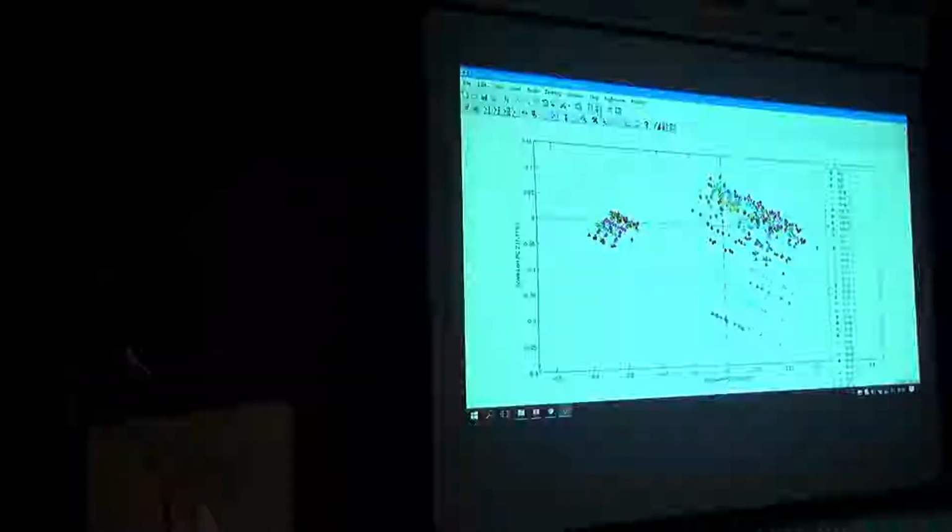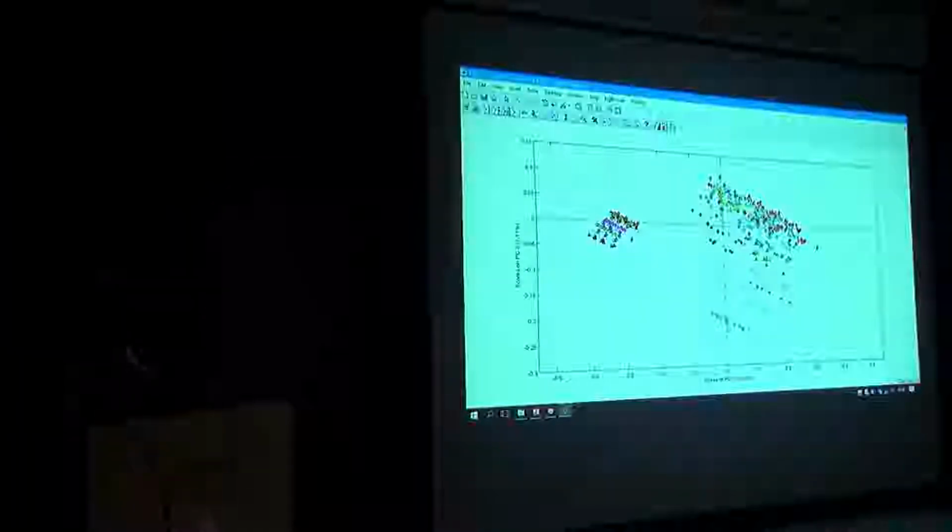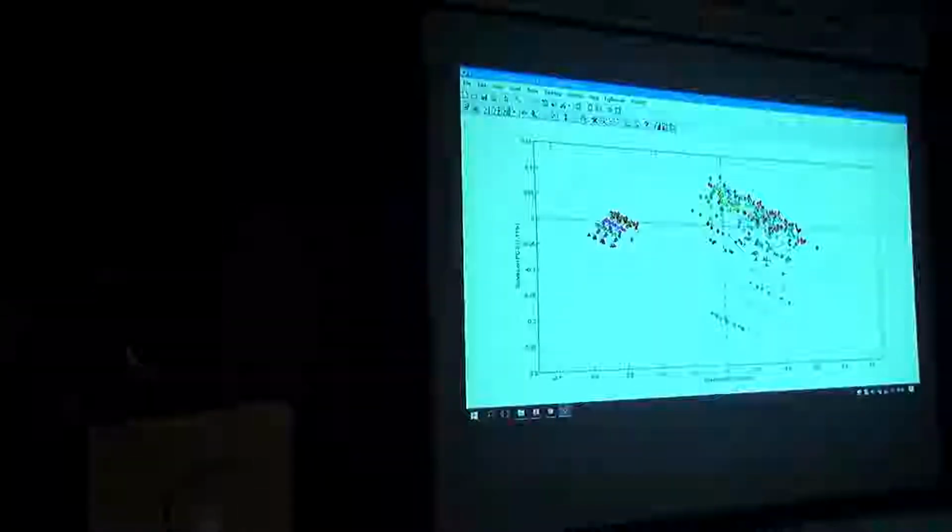So like I said, we have another label here called rep. So the spectra that are similar or identical, but have different perturbation, different temperature, different days, they're colored the same. You see all the blue ones are the same samples, but under different conditions. If you look carefully, you see that they are following certain directions. You see that direction here. So if you can identify that direction, and if you can subtract it by way of orthogonalization methods, you could clean up that picture. I want to show you how you can apply that method.